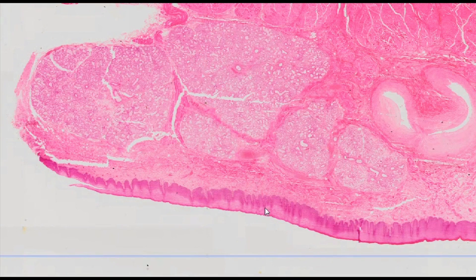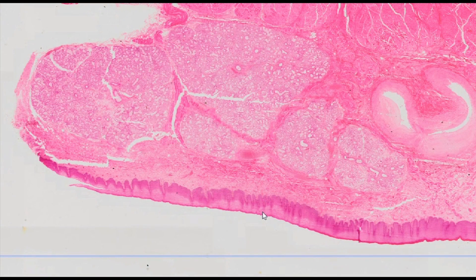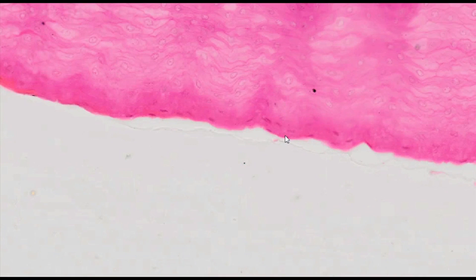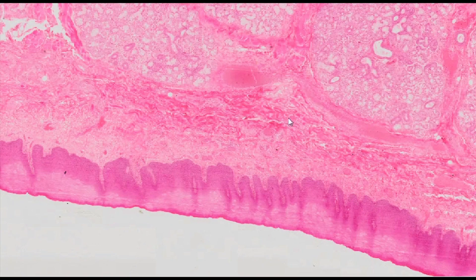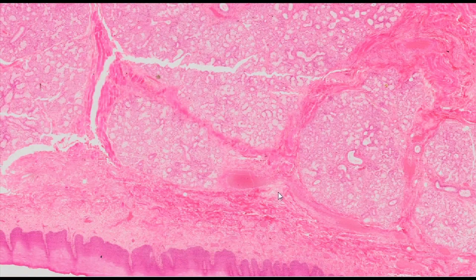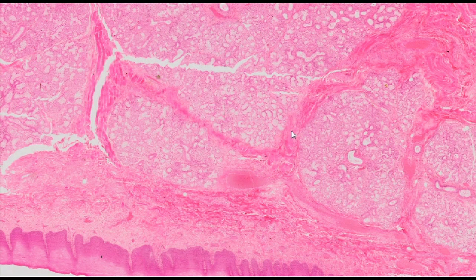The inner part of the lip is made of oral mucosa covered with a thick stratified squamous non-keratinized epithelium. The cell nuclei in the top epithelial layer can be seen under high magnification, which indicates that these are viable cells. Under the epithelium there is loose connective tissue proper, the so-called lamina propria of the mucosa.